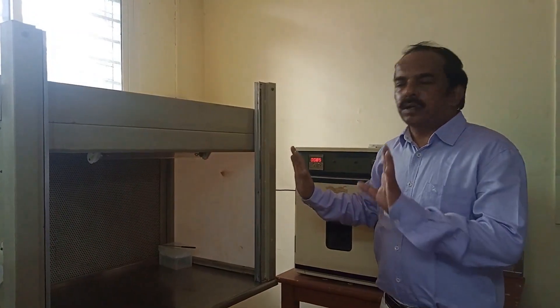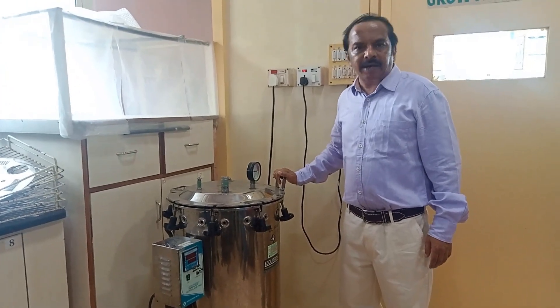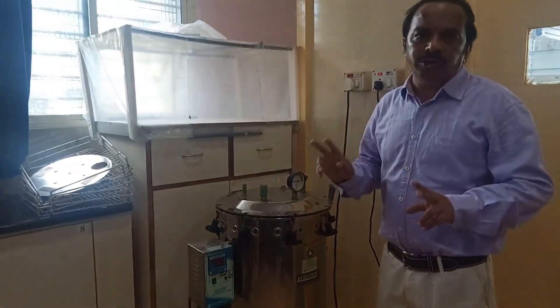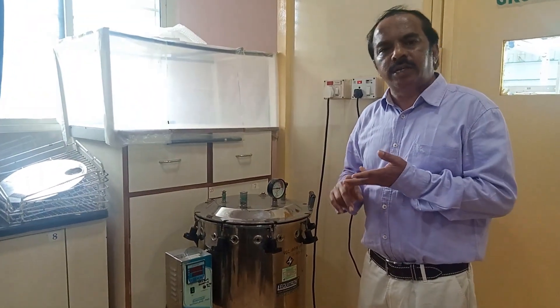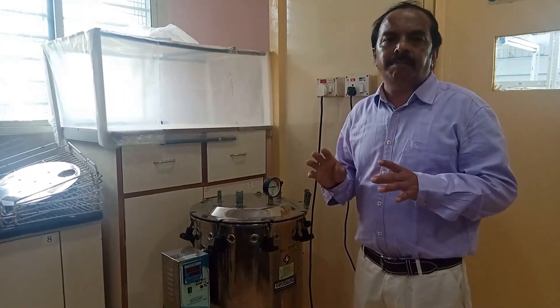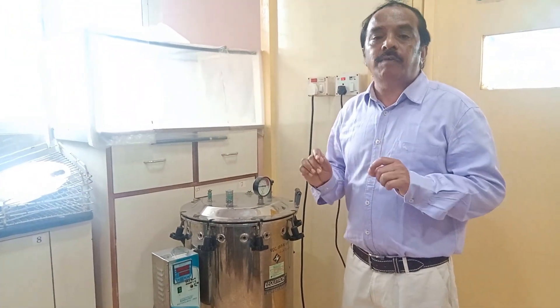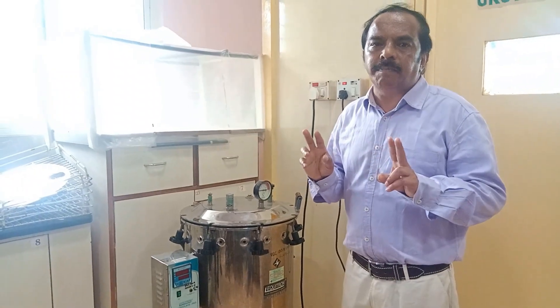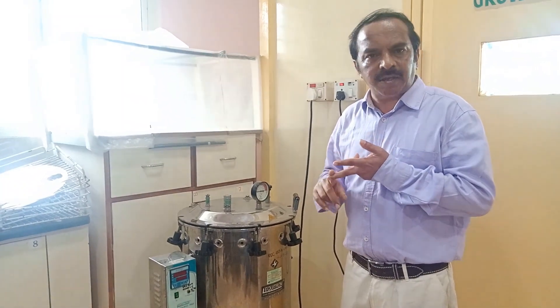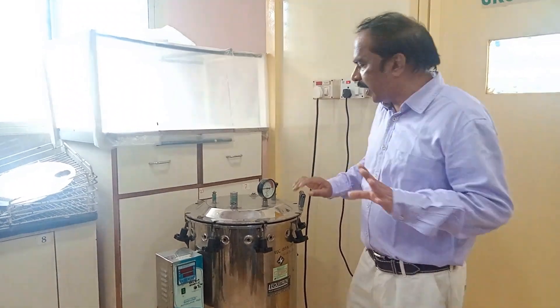The chamber is also fitted with a UV light, which decontaminates the entire area. Two to three liters of nutrient media can be prepared using this autoclave. The autoclave is essentially a large-sized pressure cooker. Two things are important in an autoclave: temperature and pressure. The nutrient media is sterilized at a high temperature of 121 degrees centigrade for 15 minutes, and a pressure of 15 pounds per square inch.